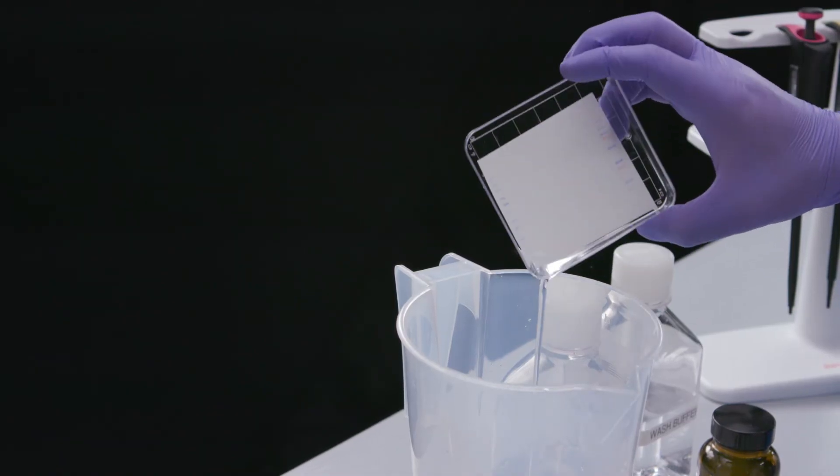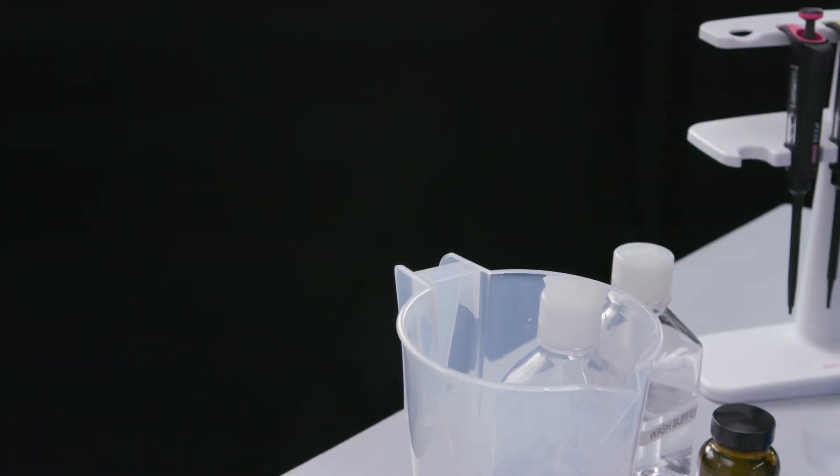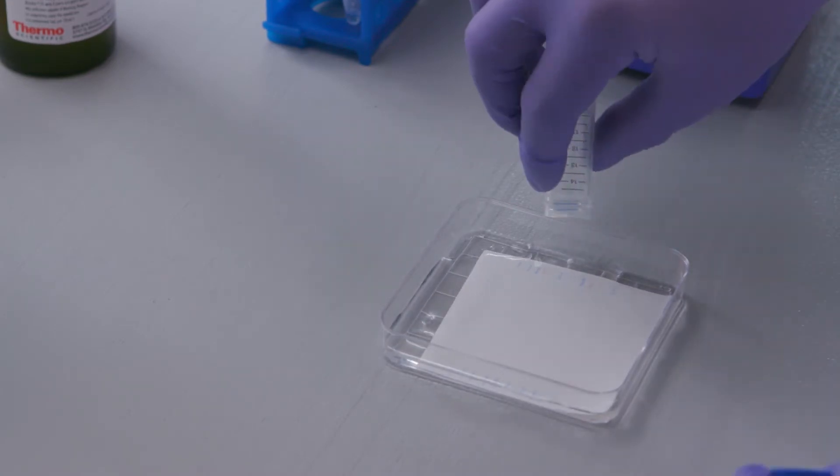Incubate the membrane in diluted secondary antibody for one hour at room temperature with agitation, protecting the membrane from light.